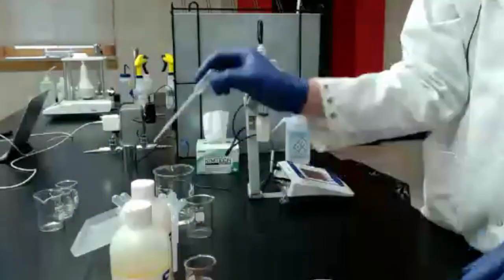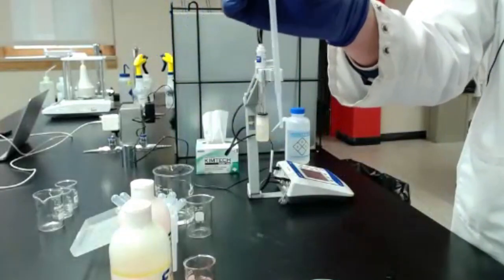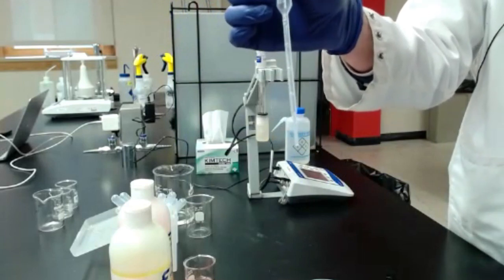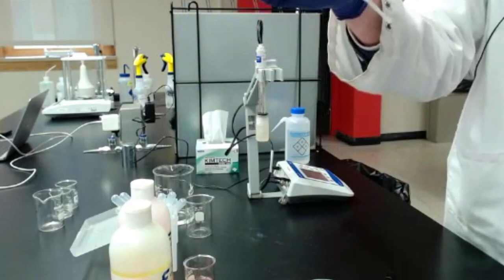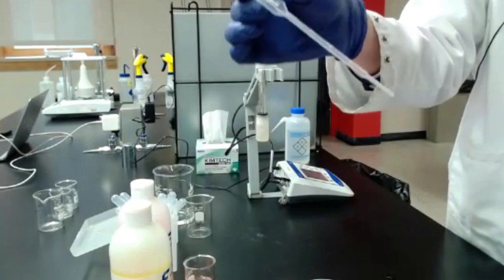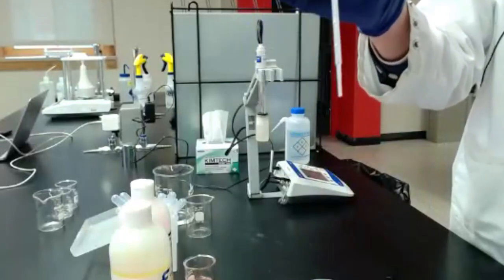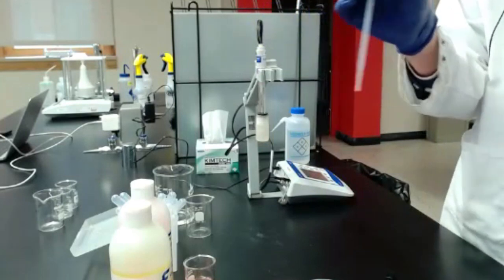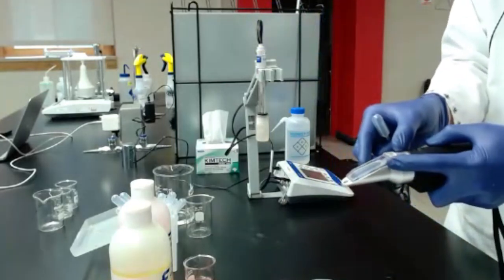All right. And then we also sent a few of the little disposable transfer pipettes. I do want to note, in the later workshops, we are going to be measuring specific volumes because that relates to some math and the calculations of how we're measuring things. These pipettes are not accurate for measuring a specific volume. They're about 1 milliliter transfer pipettes, but they're really just meant for taking a liquid from one vessel to another without being concerned about how much is being transferred. So we'll show you those other more precise equipment later.